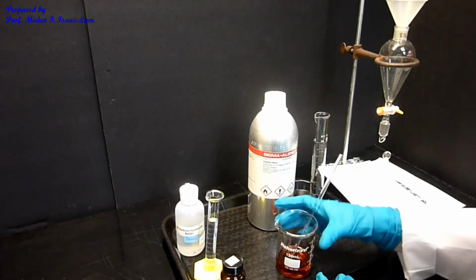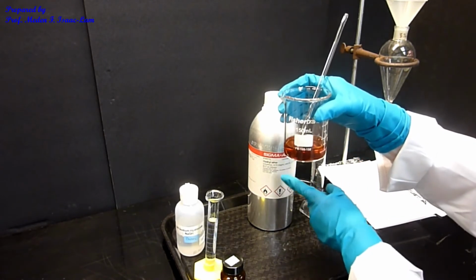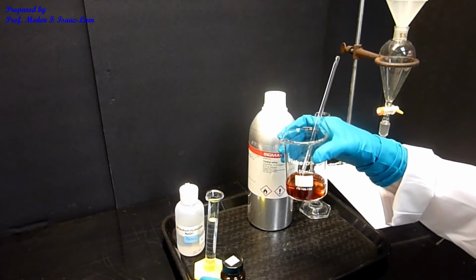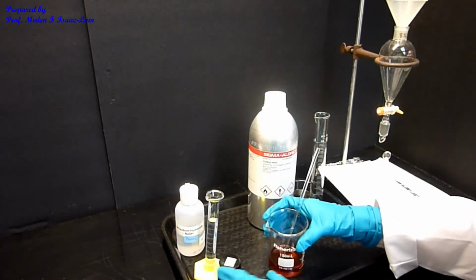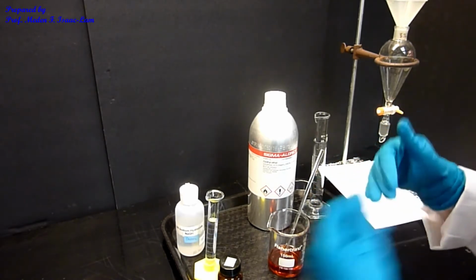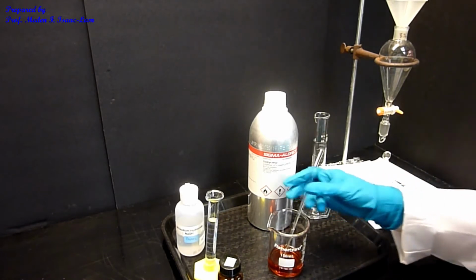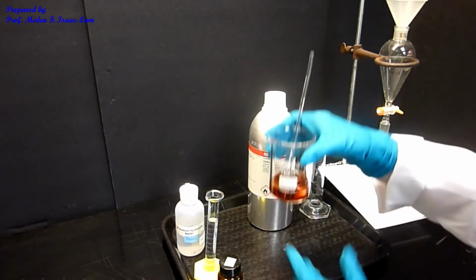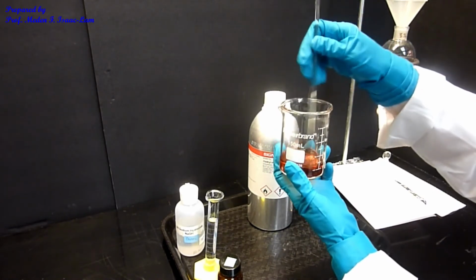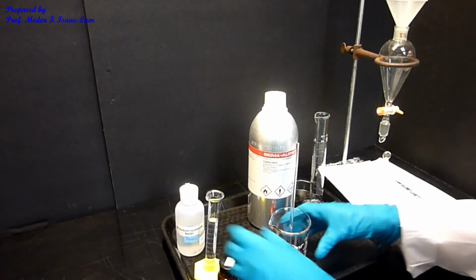So in this beaker, I have 4 components. One is the solvent, which is diethyl ether, 30 mils, and I have the three components coming from the jar, which is the three component mixture that we need to identify, separate each one, and then identify what those molecules are. Okay, I just have like one speck floating, so I think it's dissolved. And then I'm now going to add the base.